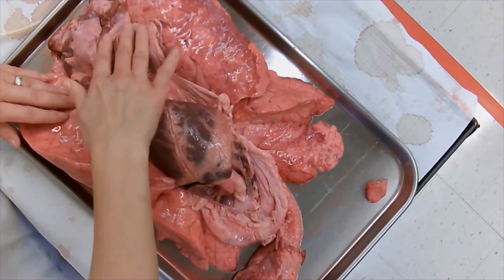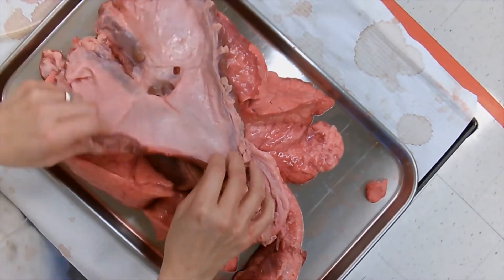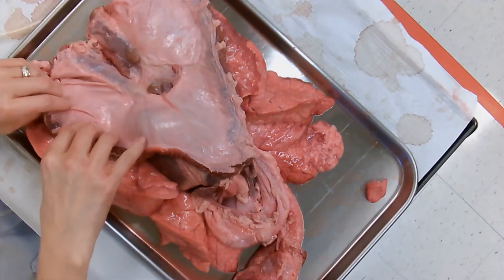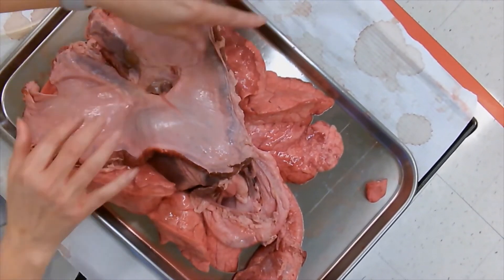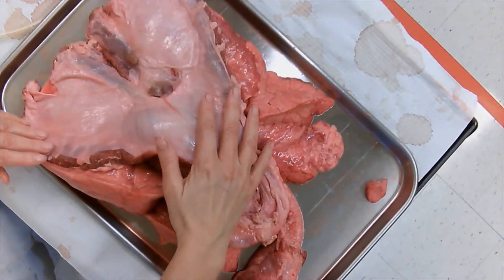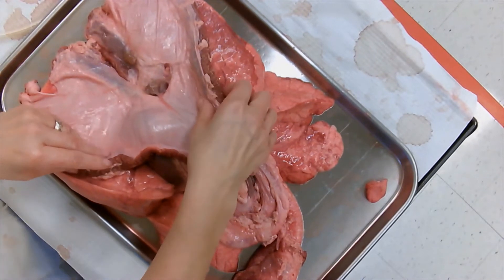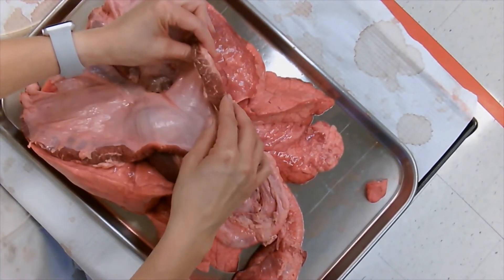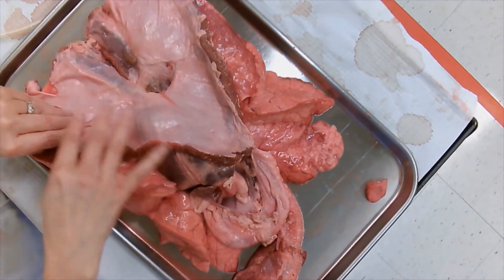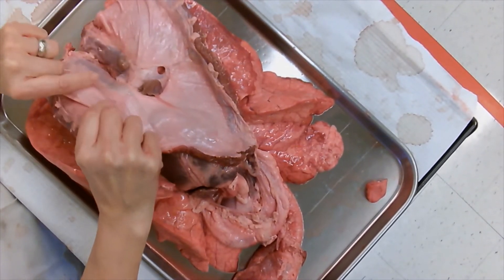So what's at the bottom of our lungs? The diaphragm is placed at the very bottom of your respiratory system. You can see here there's all the muscle going all the way around — all the muscle attached to your rib cage. It's part of the ribs, so this is nice and meaty.